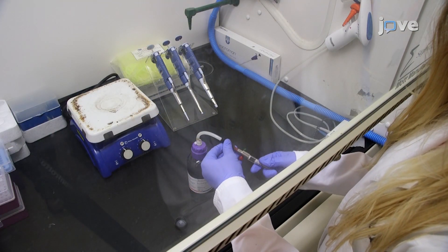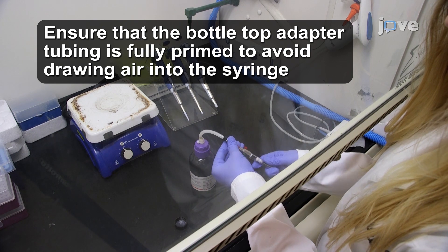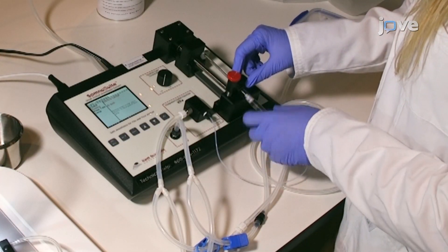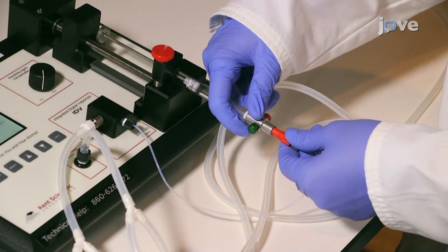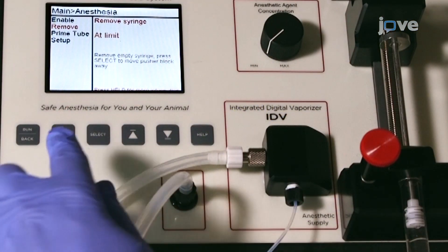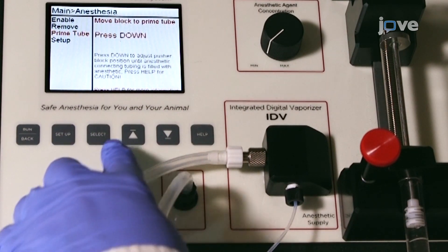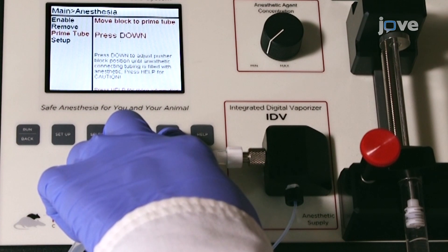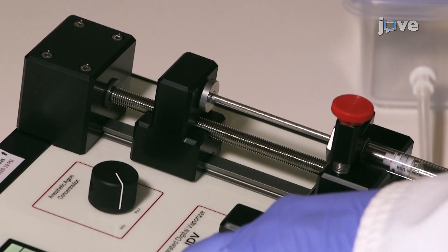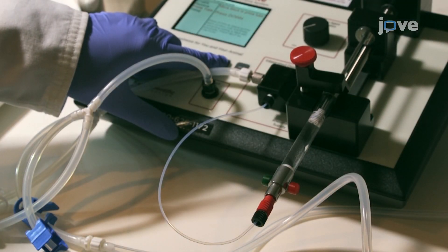Fill the syringe with isoflurane using the bottle top adapter. After filling, place the syringe back into the retention block and attach the delivery tube. Next, prime the anesthetic delivery tubing by pressing the directional buttons. The system will depress the syringe until the anesthetic travels into the vaporizer block. It is important not to over-prime the syringe.